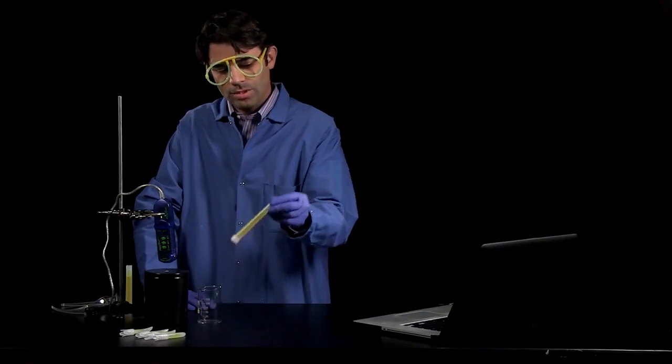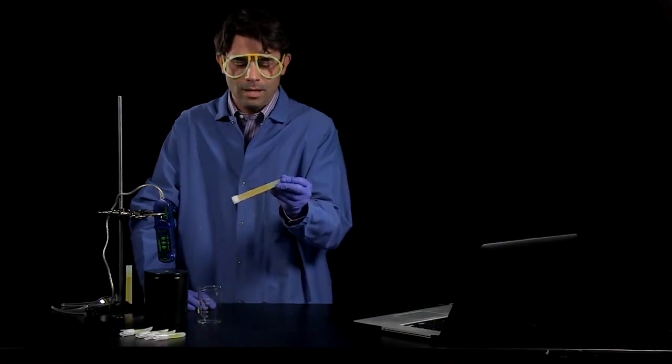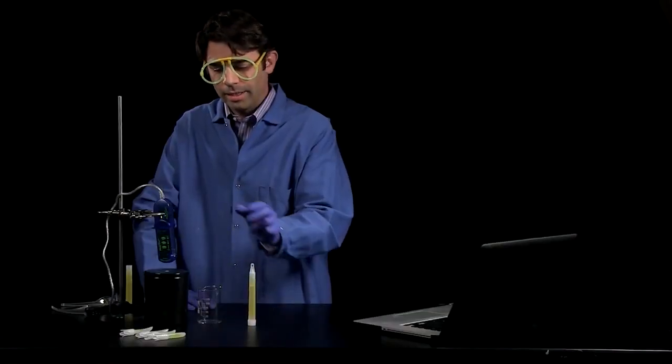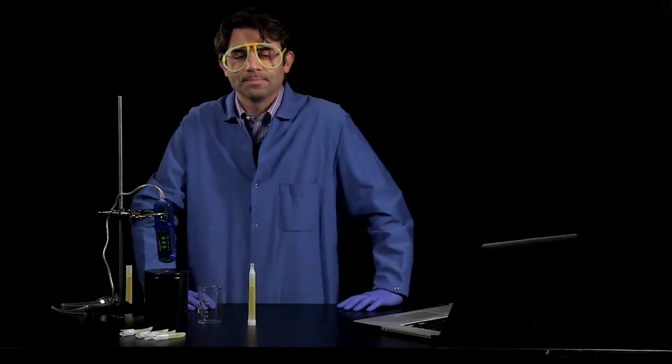Glow sticks are an example of a chemiluminescent process. What that means is the reactants react to produce energy in the form of light. We're going to study that light using our light level sensor.